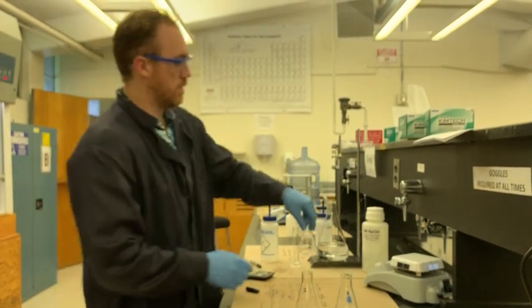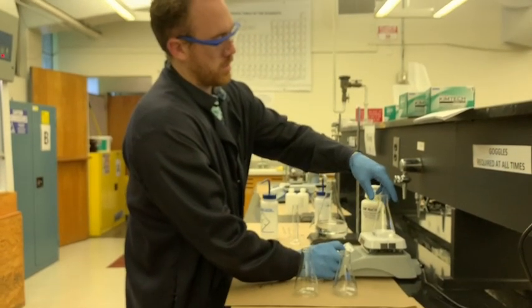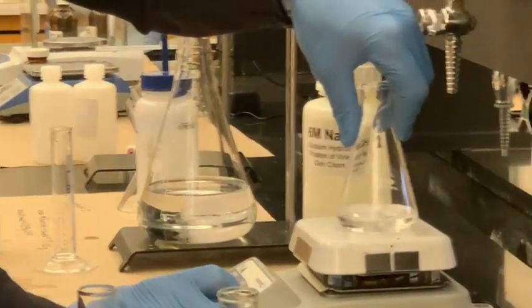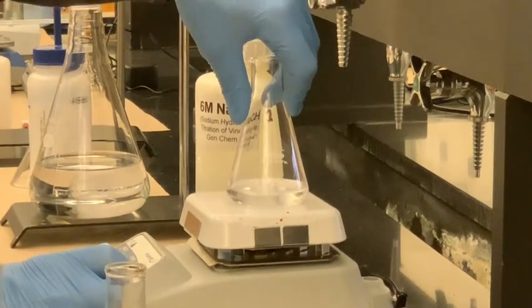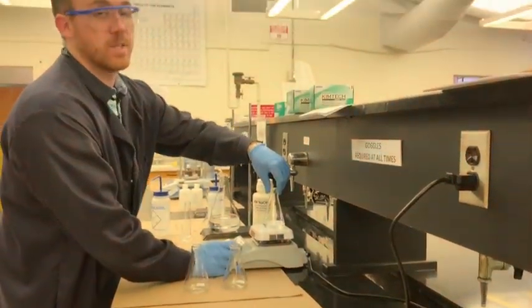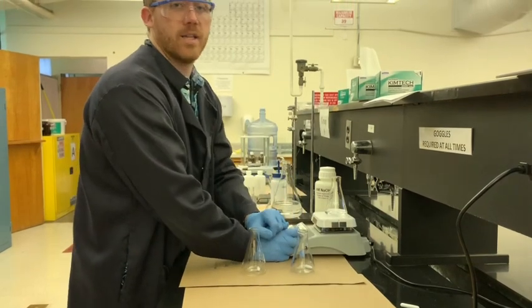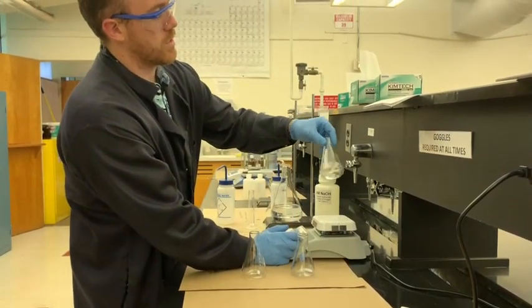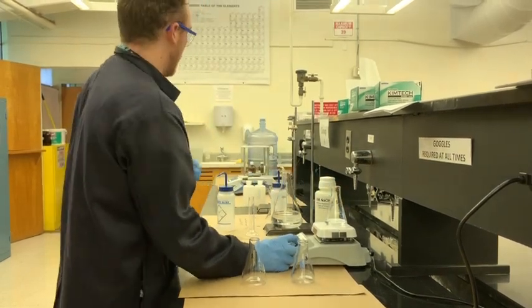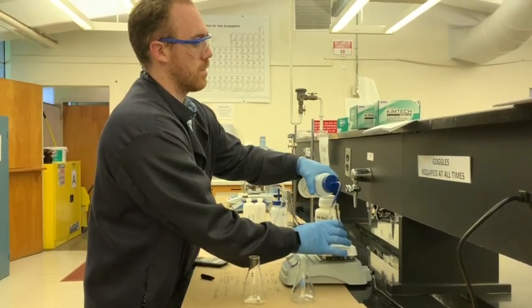So once we have this dissolved by stirring, we'll be ready to begin our titrations. And that'll give us plenty of time to actually get started working on the preparation of the burette so that we have everything in place to get the titrations going. Once the burette is prepared, which has to be done in a very particular way, we'll take each of these samples individually, one by one, and titrate them, and we'll get into that when we get there. It's fun to watch this kind of stuff. Try to avoid any splashing onto the walls though, just because if you have too much splashing from vigorous stirring, you could lose some of your sample on the walls. And that's no good. Don't want to lose any of that sample.